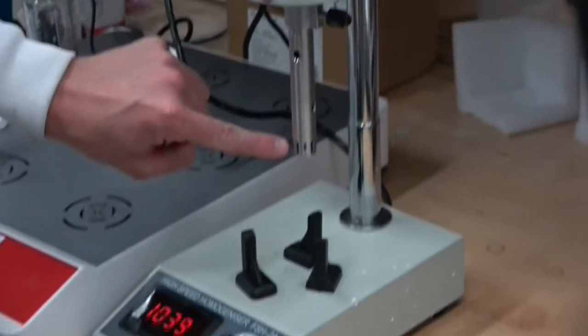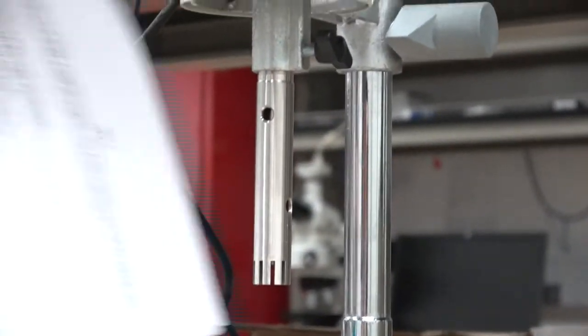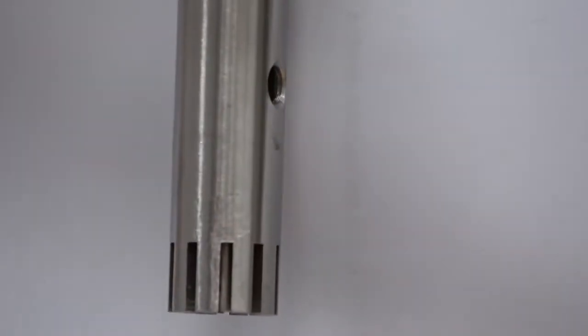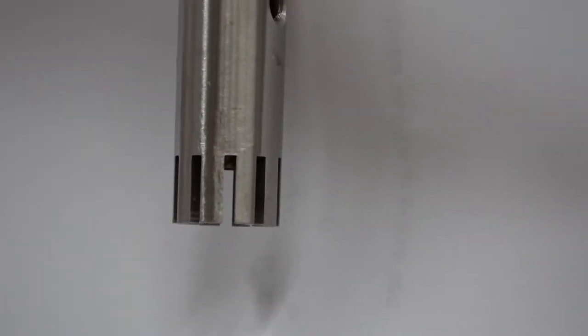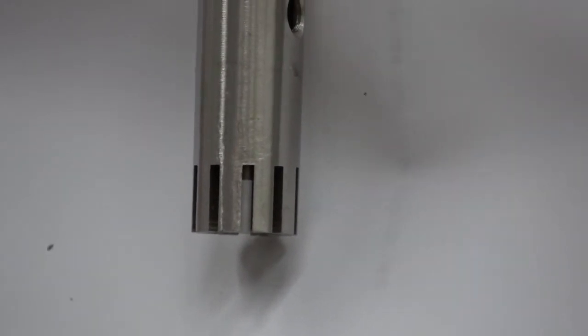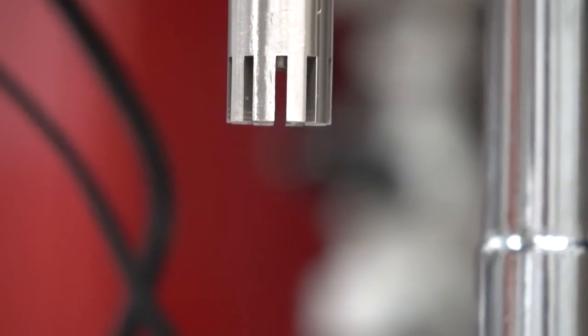You can see there's like a guard down here. You might have to zoom in. Actually, let me put some white paper behind it. So you can see it's not spinning right now, but as I turn this on, you'll hear it kick to life and rotate really quickly. So this essentially has a little stir bar in there that stirs around. Okay?